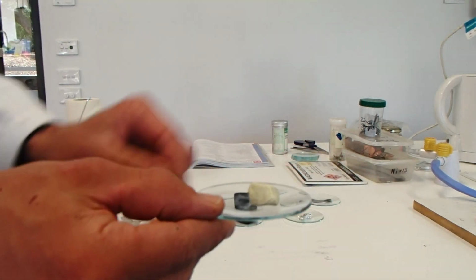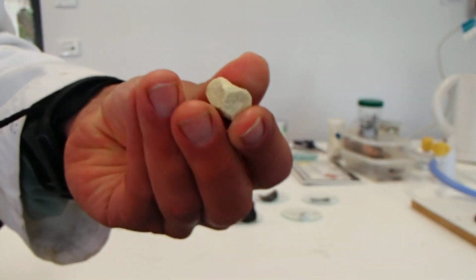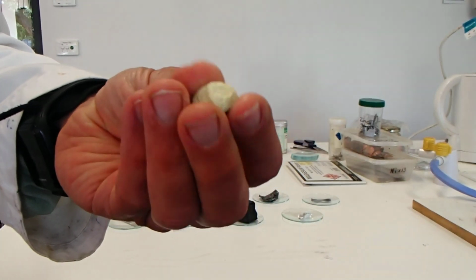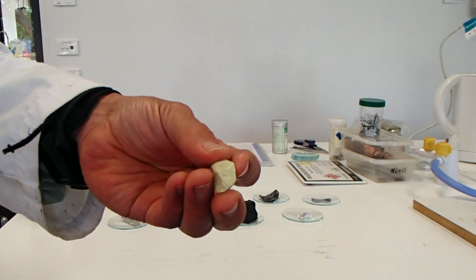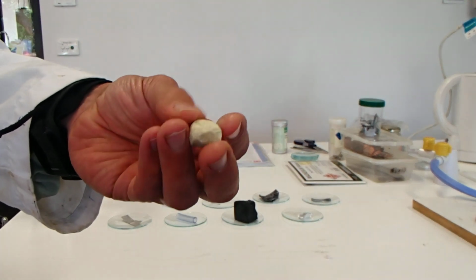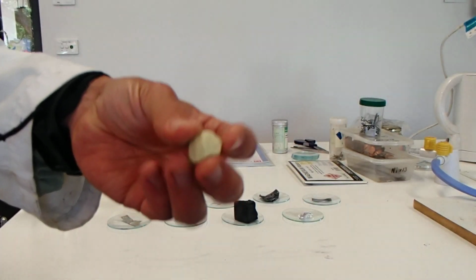Well, obviously you can see there that it's yellow. It's dull, it's not shiny, and it's shaped like a rock. So it's pebble shaped, and you can see some dust coming off in my hands there. So that's the appearance of sulfur. You should be writing these appearances into the table that you've created in your workbook on your computer. So sulfur, it's dull, it's not shiny, it's feeling dusty, quite light.